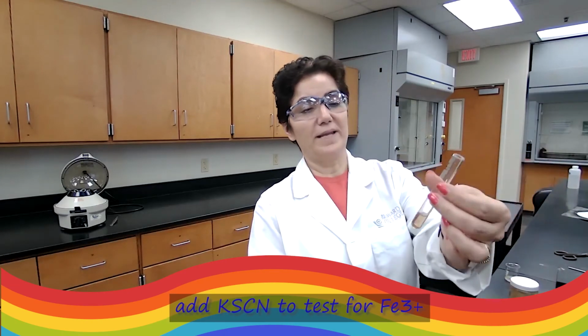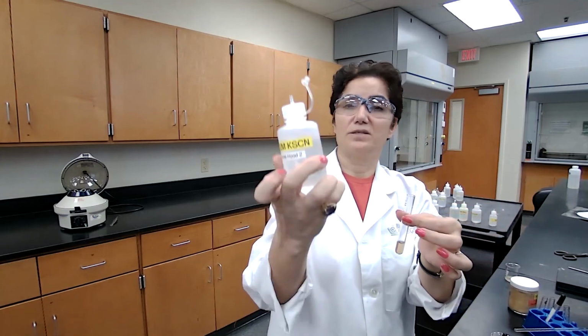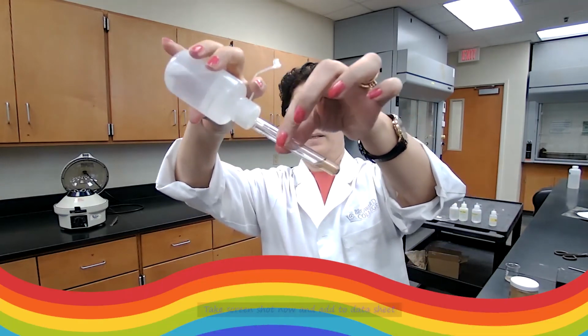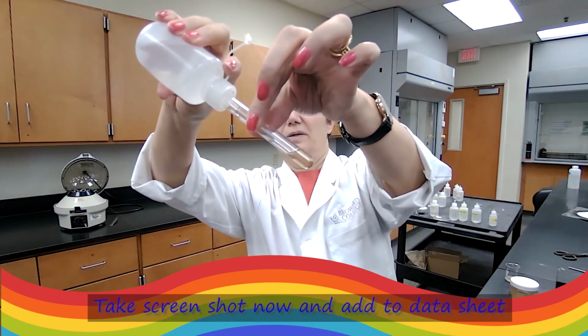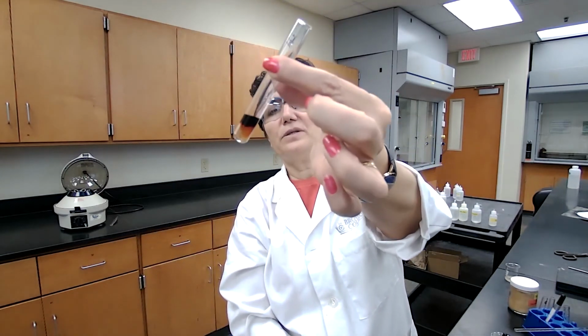Okay. To the next test tube, which is test tube E, we are adding potassium thiocyanate and testing for the presence of iron. And I want you to record your observation.